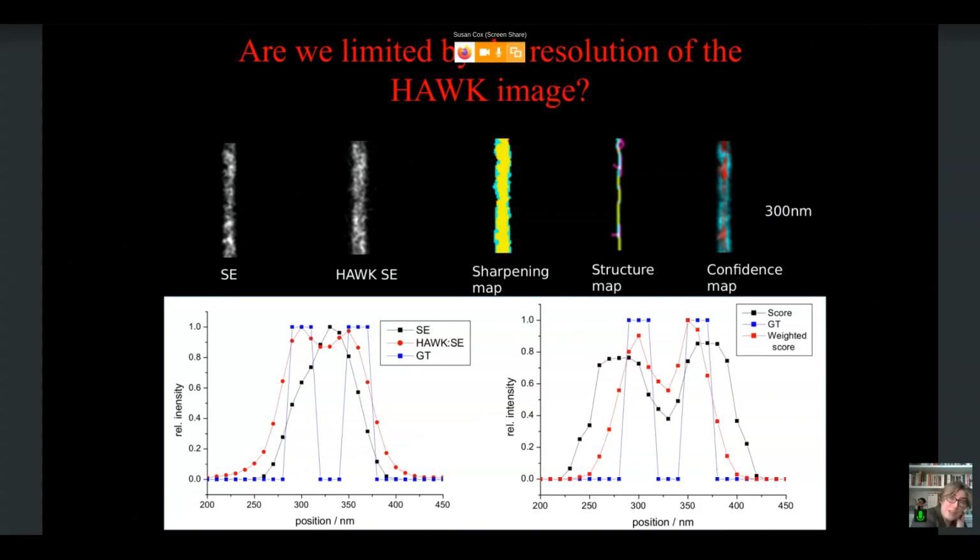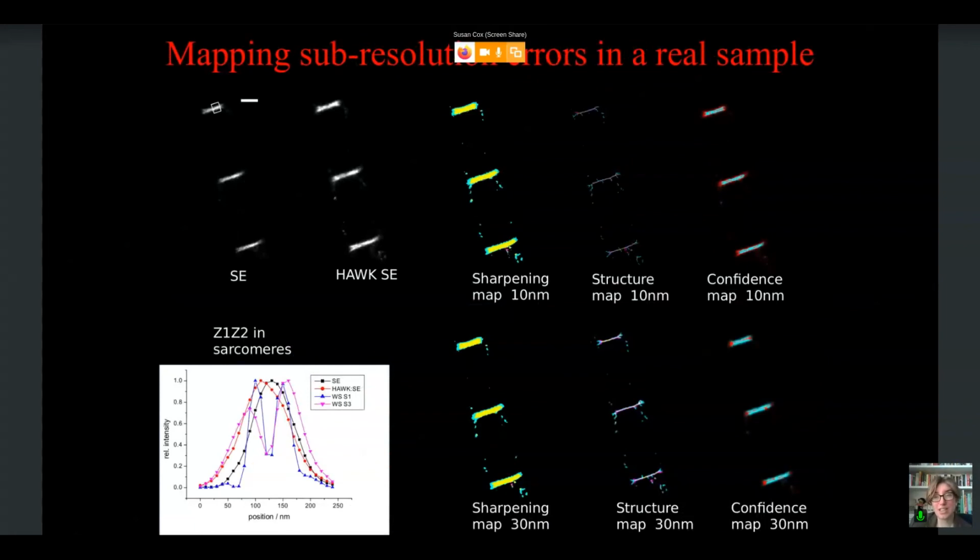And we were then, of course, intrigued, could we see this in the real structure? So we used the Z1, Z2 structure, which is a very small separation of around 60 to 70 nanometers. Now, of course, normally one would be able to resolve that with super resolution, but we are operating at very high density, and the sarcomere structure, as I said, has a certain thickness, which tends to make all the separations less distinct. And what we found was that while we couldn't really see anything in either the Hawk single emitter or the single emitter images, we can see a small degree of separation at the very edges, but not in the center. If we look at the confidence maps for these small length scales, we are identifying that there should be two structures that are separated rather than a single uniform structure.